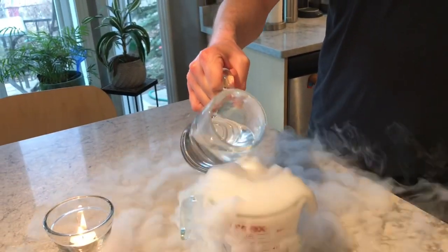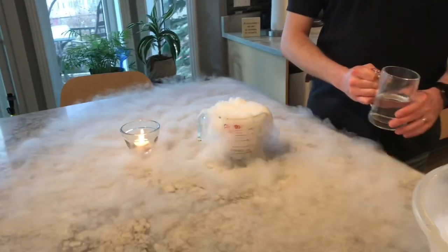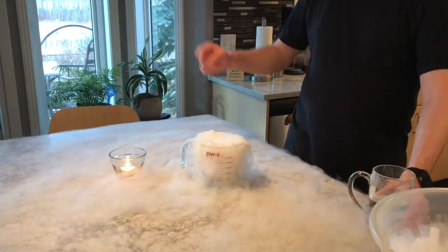Professor Marcus, you're missing some cool stuff here. I'm just getting this. Oh, getting gloves. Good thinking.